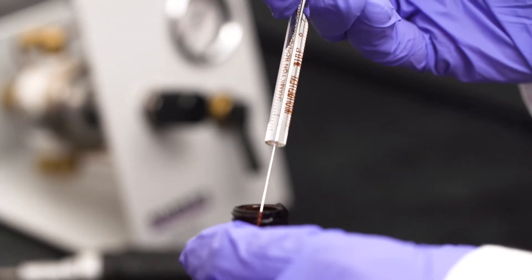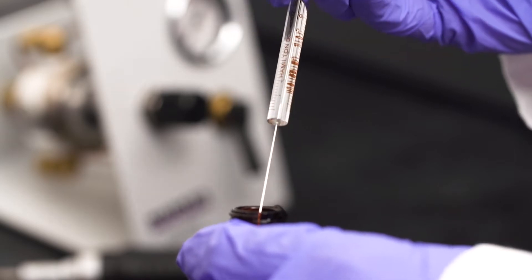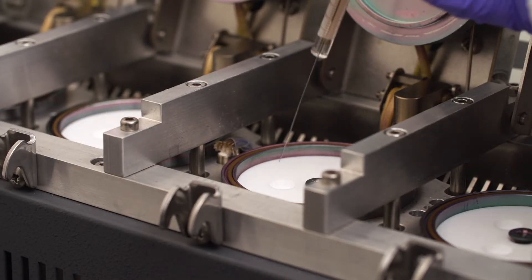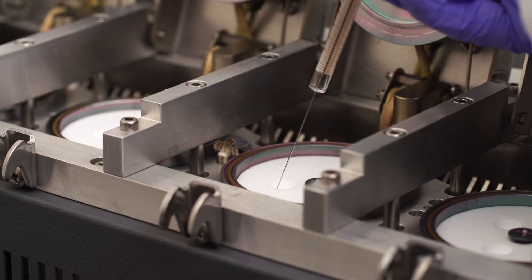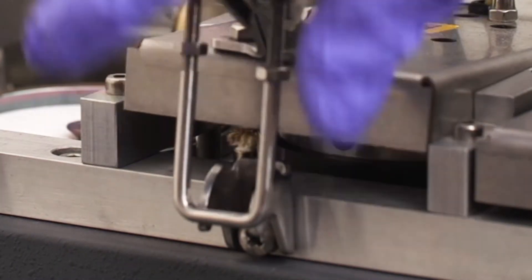A desired amount of neat standard mix or standard in solvent should then be introduced into the sample block wells, such as 1 to 10 microlitres. The lid of each chamber should be immediately closed after injection before moving on to the next chamber.